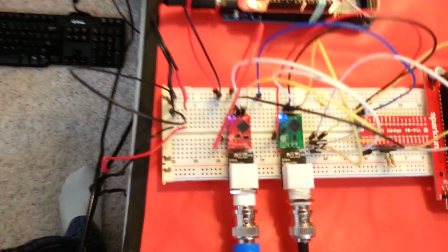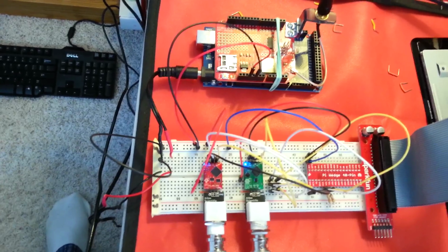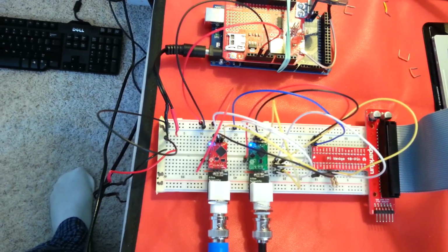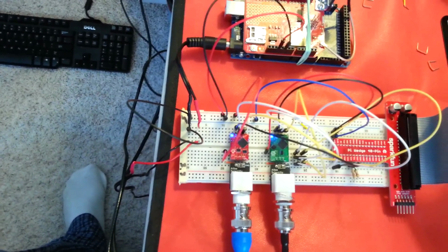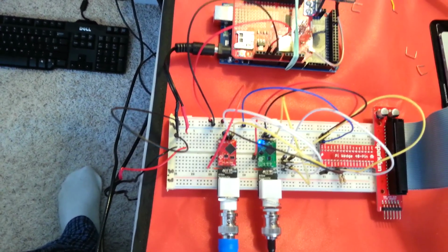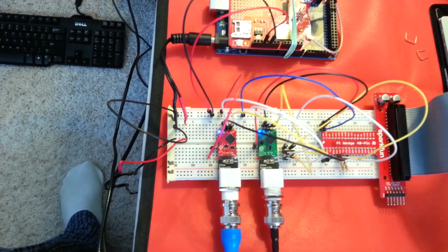I'm going to get some isolation circuitry over here so I can isolate the data lines, power and data lines. The power lines, of course, are isolated right now, but for using a single power source, we'll be able to have isolated power and data lines on four probes. The EC probe doesn't need isolation, but the pH probes do. So if we're going to use more than one pH probe, the circuit that I intend to buy, it's $33. You can isolate four probes on one circuit.